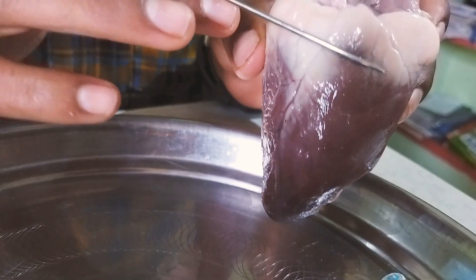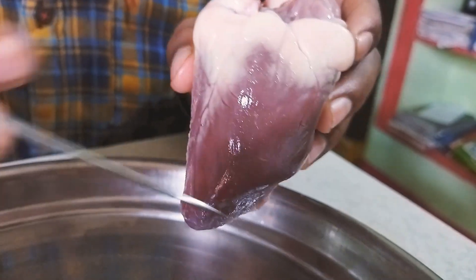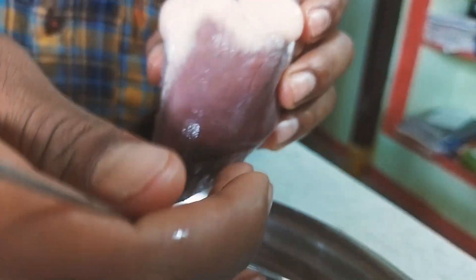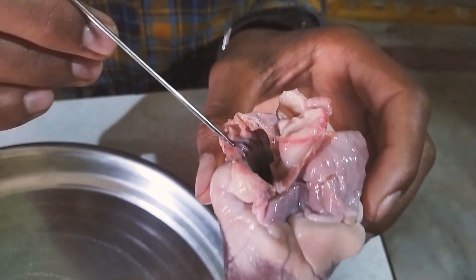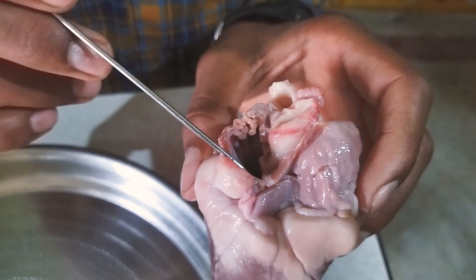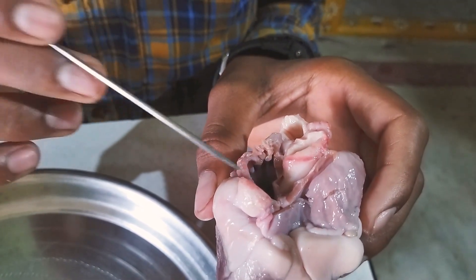I have taken a goat heart. This is the right side of the heart, and this side is the left side of the heart. This lower part is known as the apex. This is the superior vena cava.